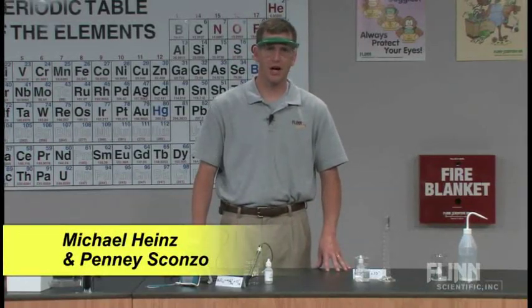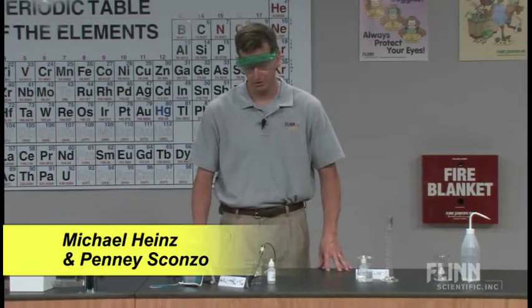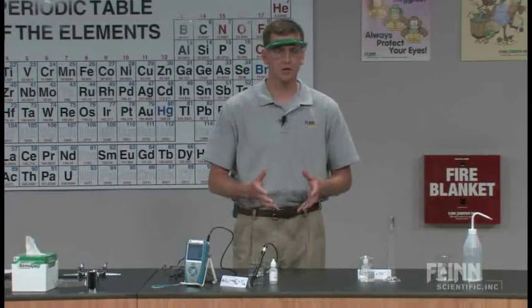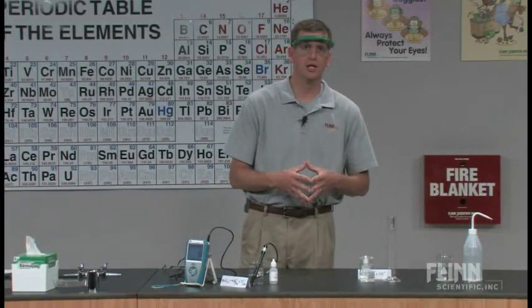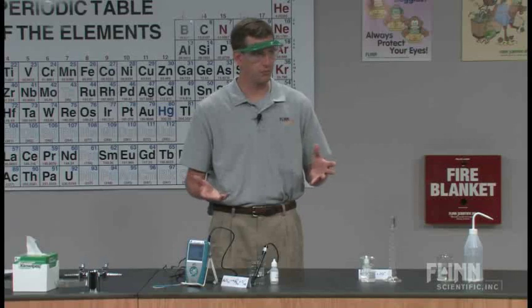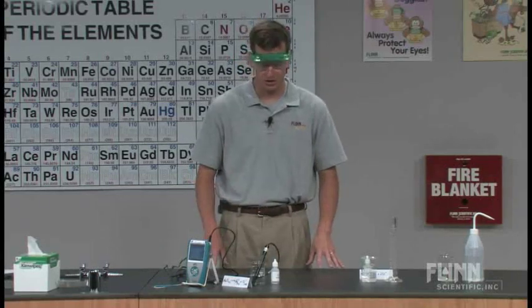This demonstration is going to illustrate the dissociation of ions in an aqueous solution. We could use this anywhere from solution stoichiometry to ratio of particles, balancing equations.